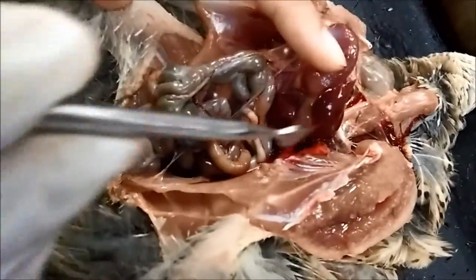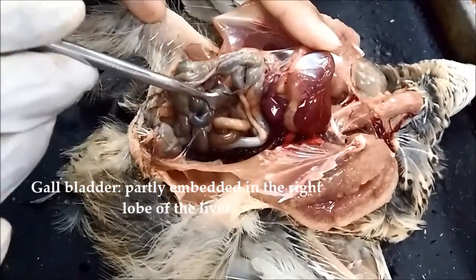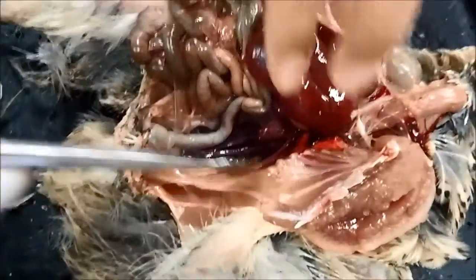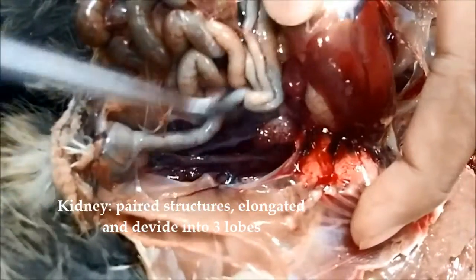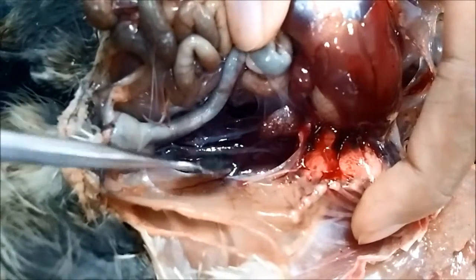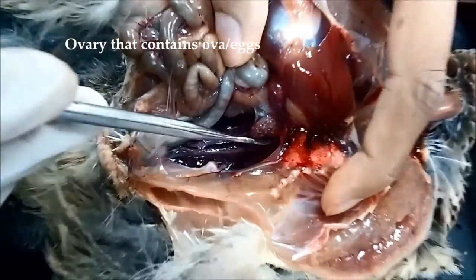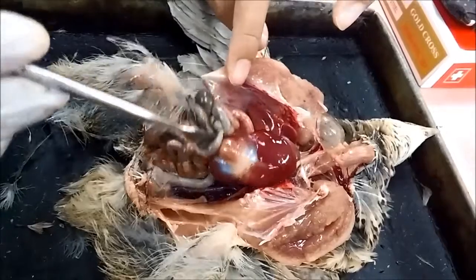This is the gallbladder. This one, small one. Here. Okay, next, if we go down here, we will see this is the kidney of the bird. It's a little bit hidden. We need to see it carefully. So this is the kidney, and on the upper side, this is the ovary that contains ova or eggs. Okay, I think that's all for the internal anatomy of the bird.